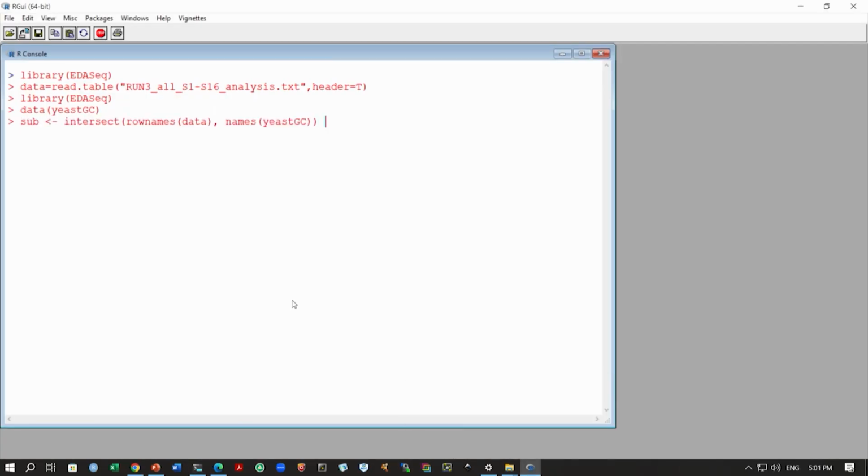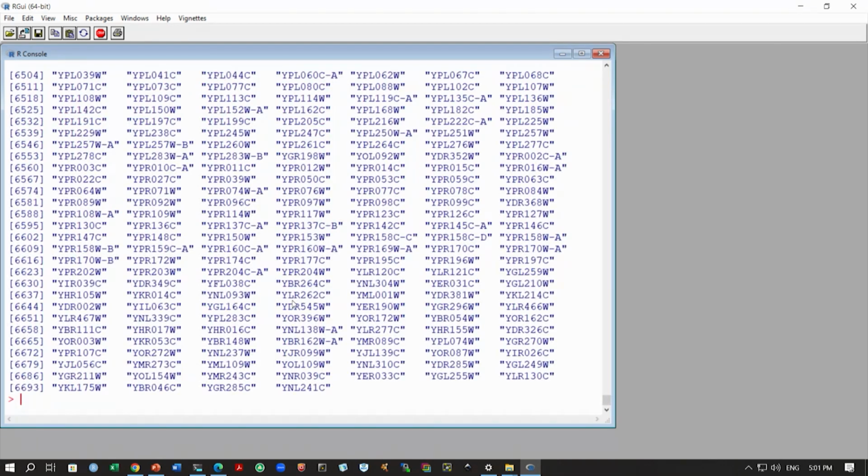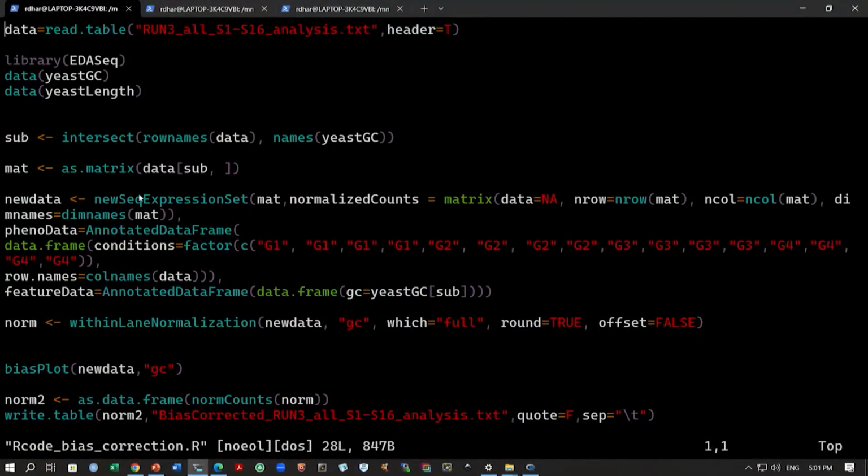So here we are, and we can find out these are the gene names that are common. This is a large majority, as you can see: out of 6,800, about 6,700 are present in both these data sets. So that is good. We have found most of the genes in these two data sets.